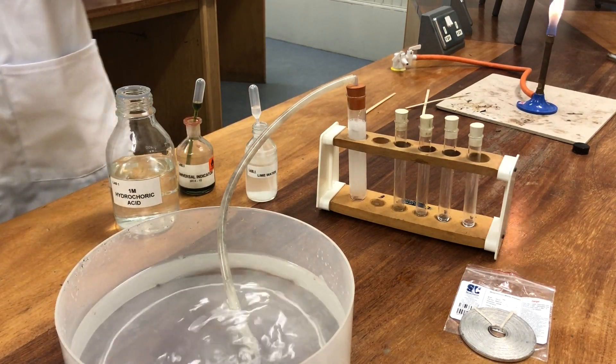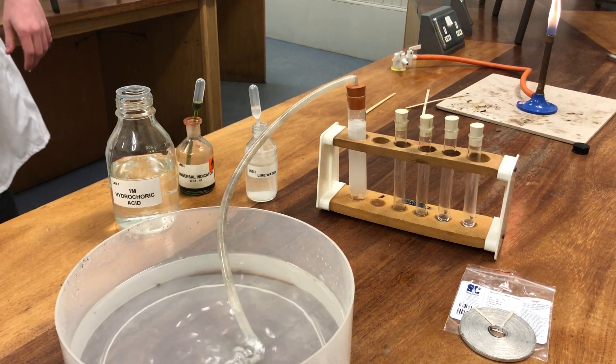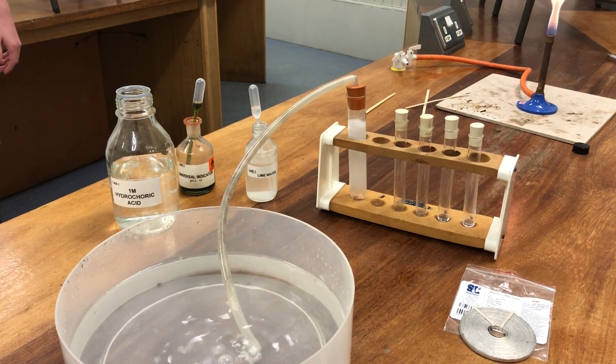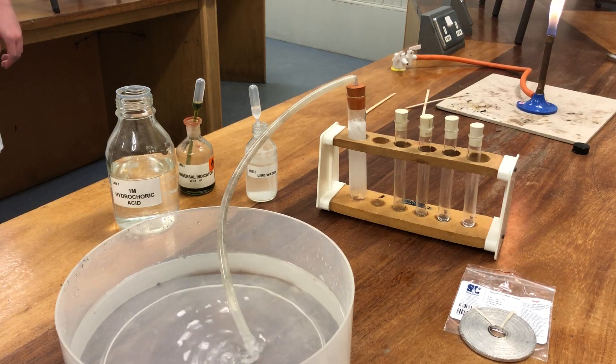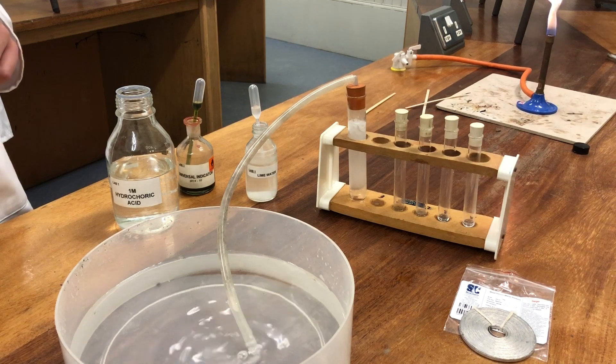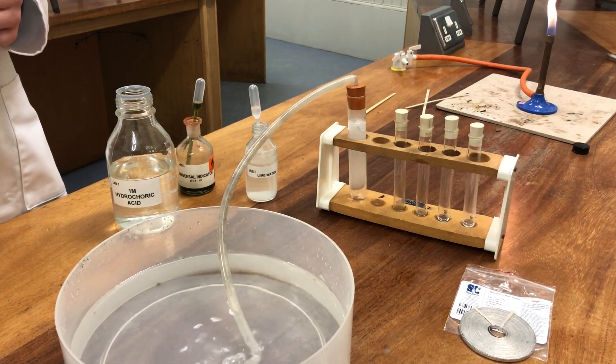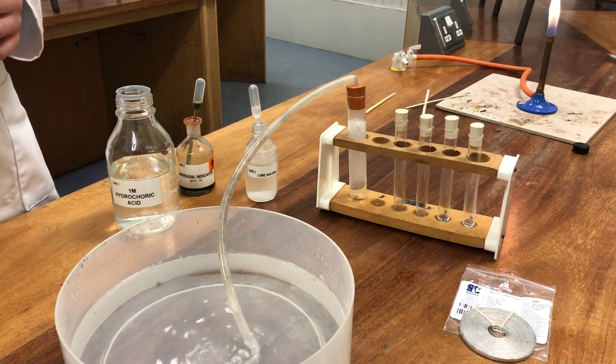I have collected four test tubes earlier and we'll do the standard gas tests. You will see from the gas in the tubes here that hydrogen is clear and colourless and that it is bubbling freely, so it is insoluble in water.